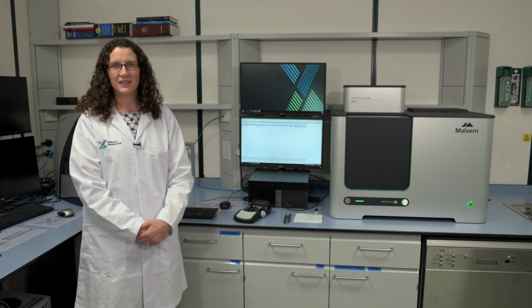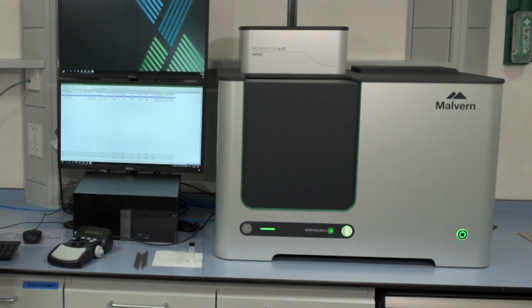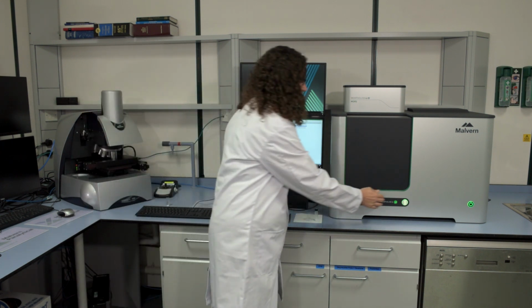This is our automated static imaging system combined with Raman spectroscopy, which gives us morphologically-directed Raman spectroscopy. And this enables you to get component-specific particle characterization. So you can get the particle size or particle shape information about single components from within a blend. It's morphologically directed because we use the morphological information from the static imaging measurement to direct where we get the chemical information from, which particles we'd like to get a Raman spectrum from. So I'll just open up the system and let you see inside.